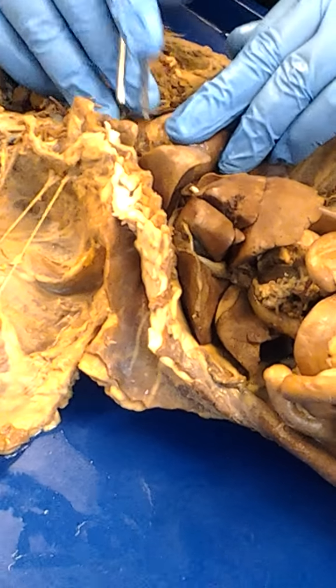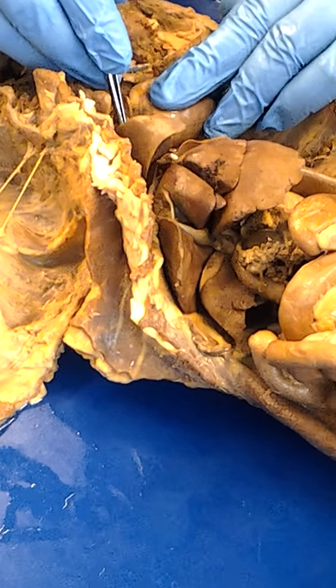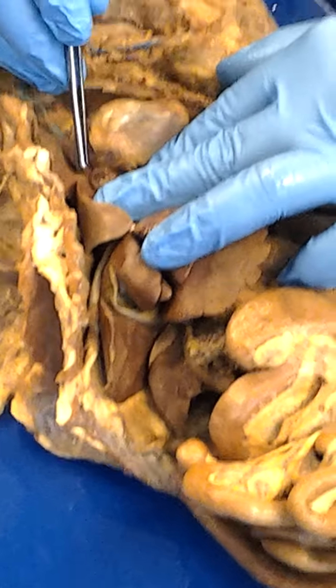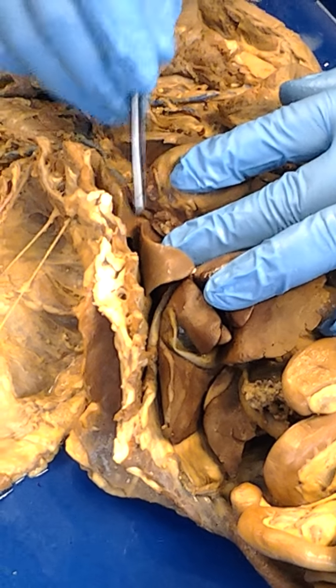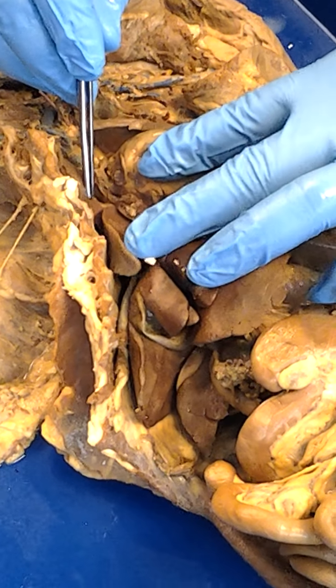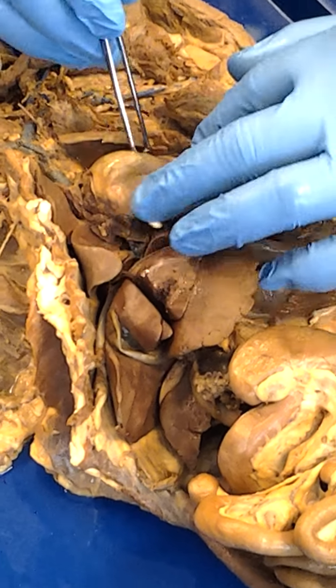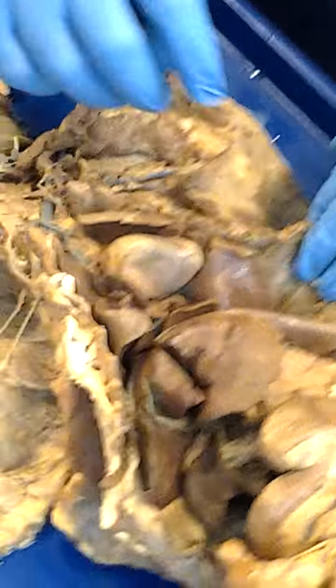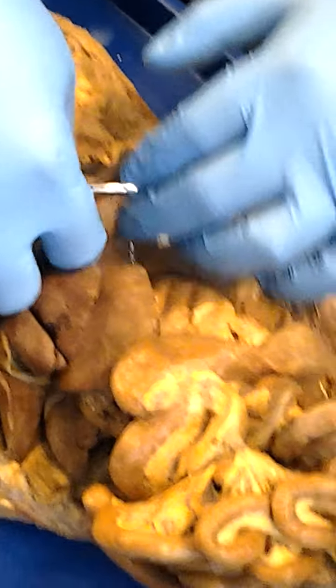No, the lung isn't good on this one. That's too bad. Usually I can find a pulmonary artery, like a blue blood vessel coming off the lung, and that would be a pulmonary artery off of there. And you can see that coming from the lung and heading towards the heart. I mean, coming from the heart and heading towards the lungs. All right.